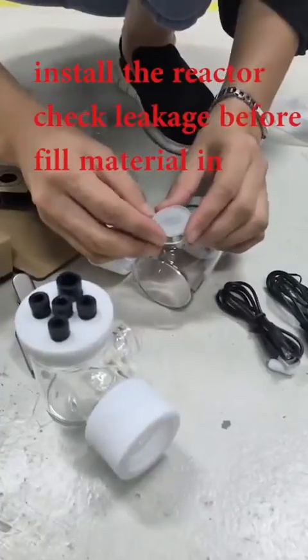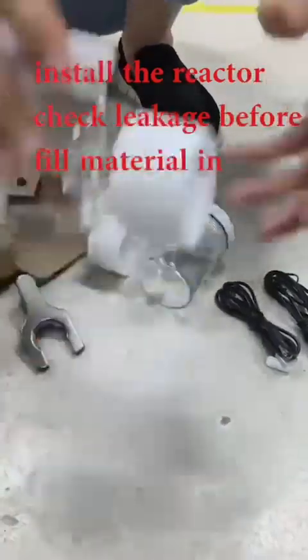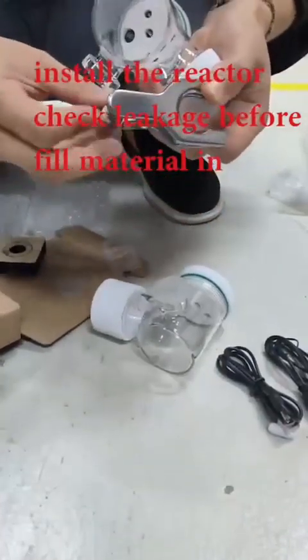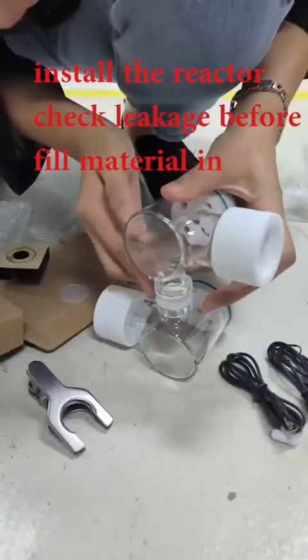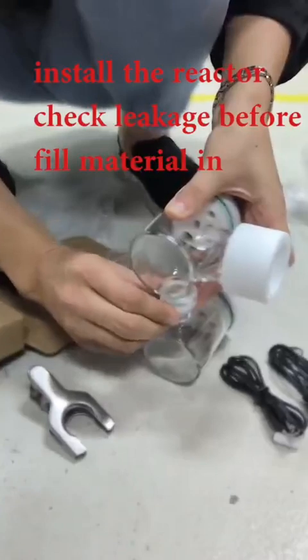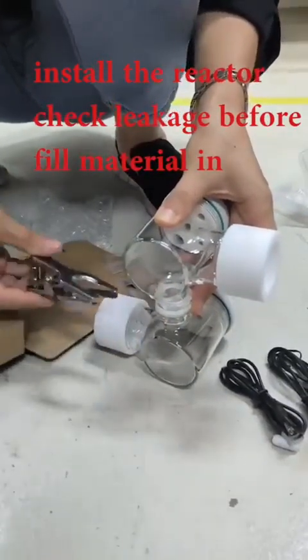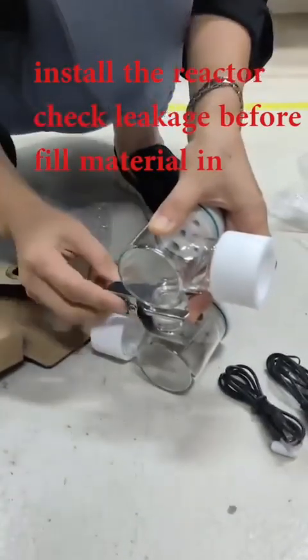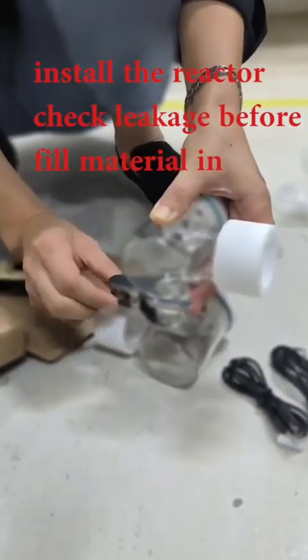Slip down. Okay, hold it properly. Use the reactor to slip down. Hold. If you do not hold everything, it may leak. Hold, then lock. Use the screw here to lock it.